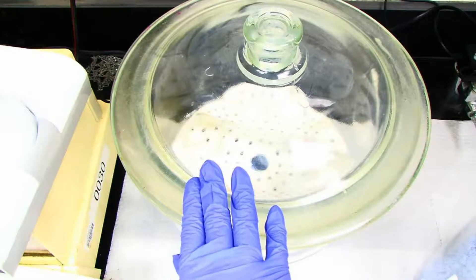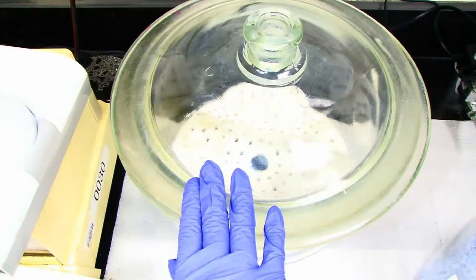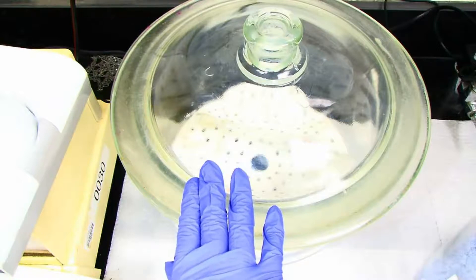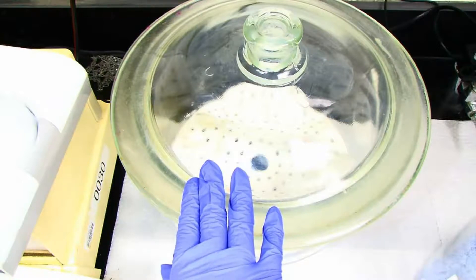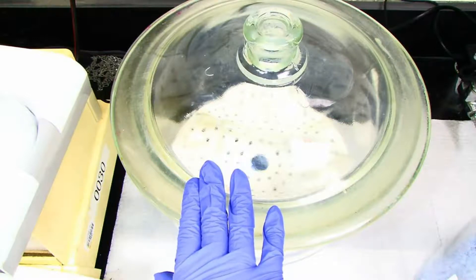In the lab, you should remove a round bottom flask with magnetic stir bar and a condenser and immediately assemble and place your drying tube on top. Then take your assembly to your workstation.